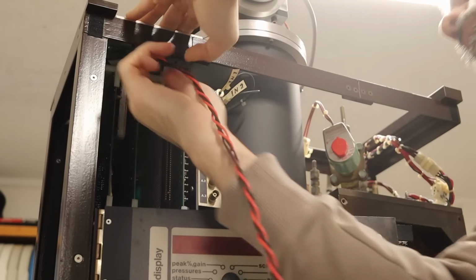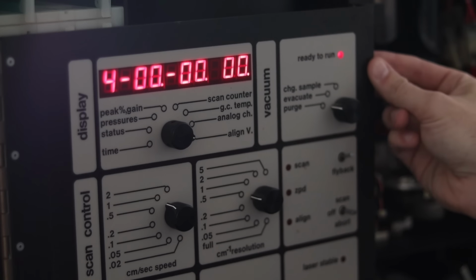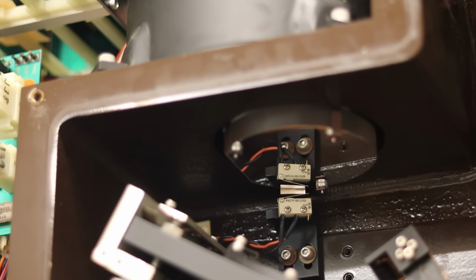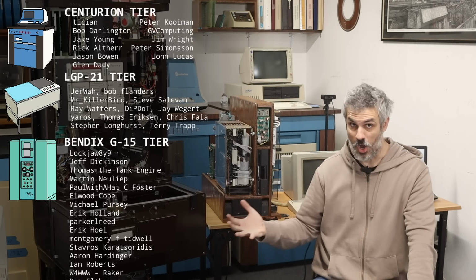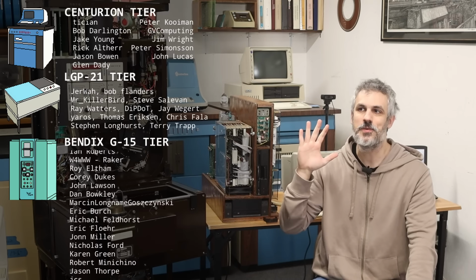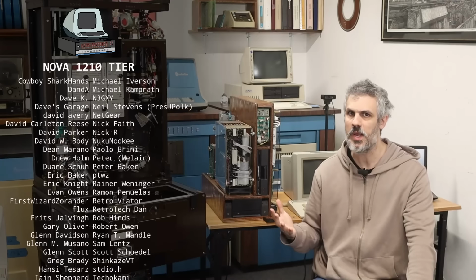After putting power into that opto-isolator board up there, we flipped the power switch on the Bomem here with the 50-pin cable disconnected just to make sure that everything was copacetic, and the Bomem comes up totally fine, goes into mode 4, finishes its boot up sequence, ready to go. However, if I turn the Bomem off, plug in the 50-pin cable, and turn the Bomem back on with the PDP-11/73 off, the Bomem freaks out. It goes to mode 2 immediately, and it starts power cycling. Like the front panel starts flickering on and off. I can hear relays kicking off, the lasers turning on and off, and it's doing it at random intervals.